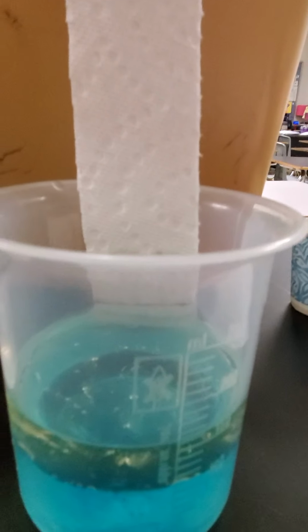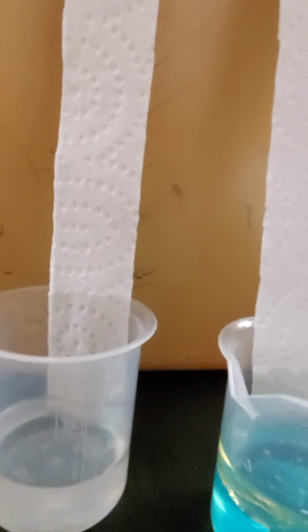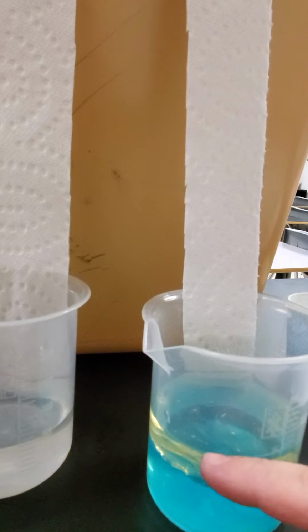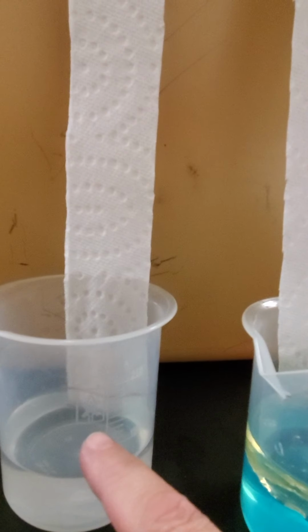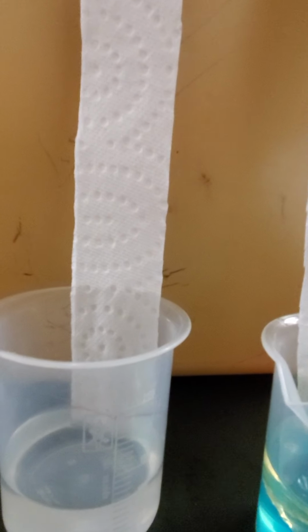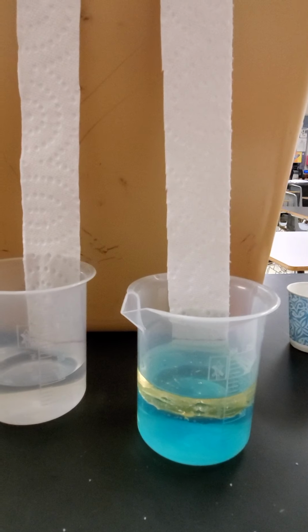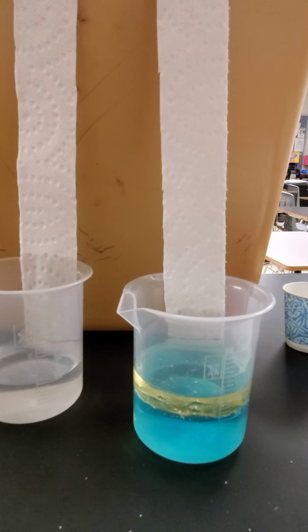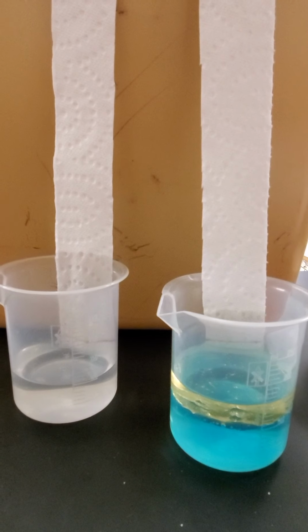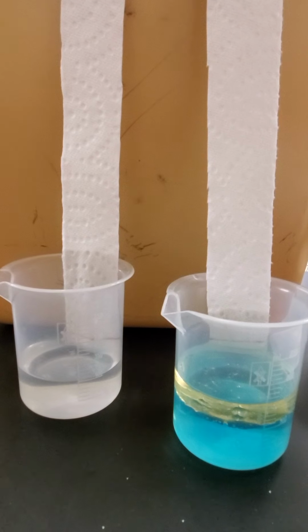All right, so it's been a couple minutes, and here is the oil in the water. And then here is just the regular water. So this is with the paper towel just sticking in the oil layer, and then this one goes to the water. This one does not touch the water, and that one does. So you should be able to answer the 2 questions, and then go on to the 3 reflection questions after that. All right, that's it.